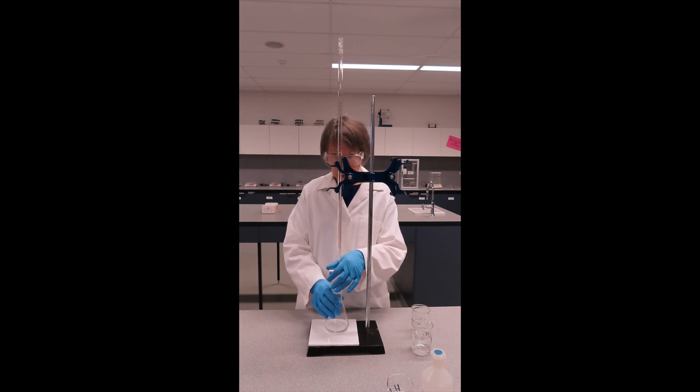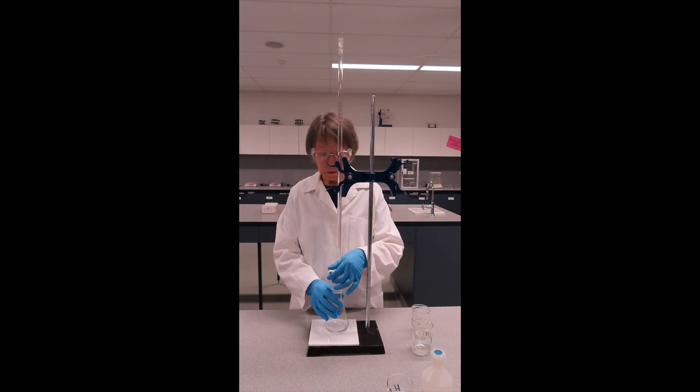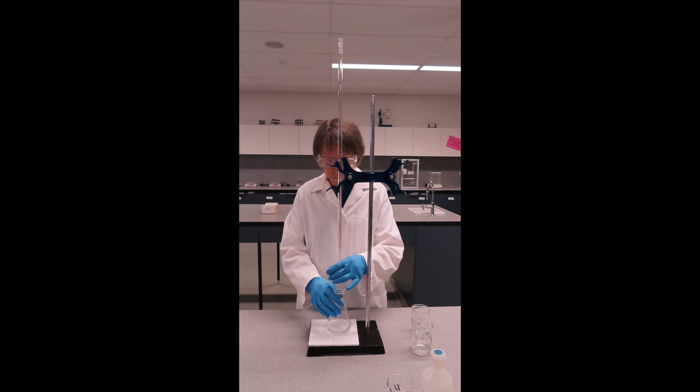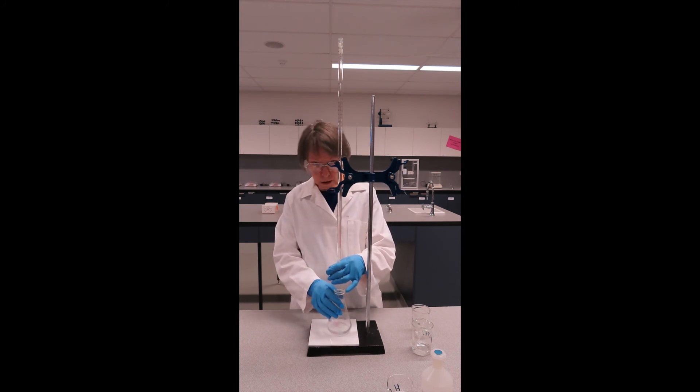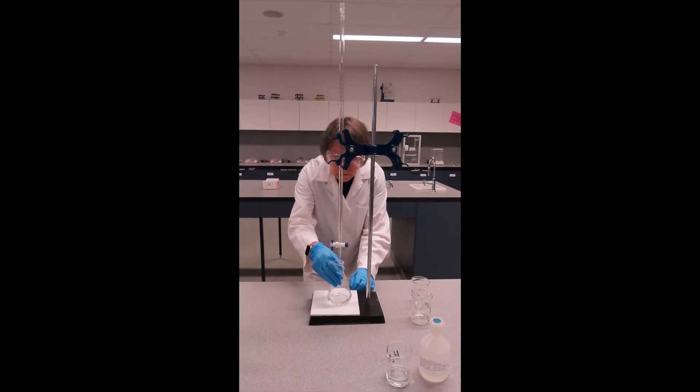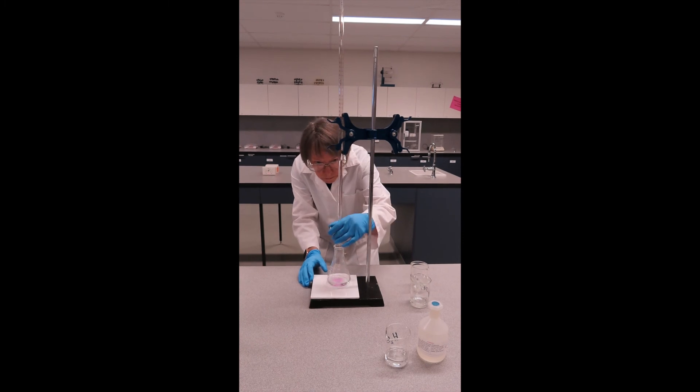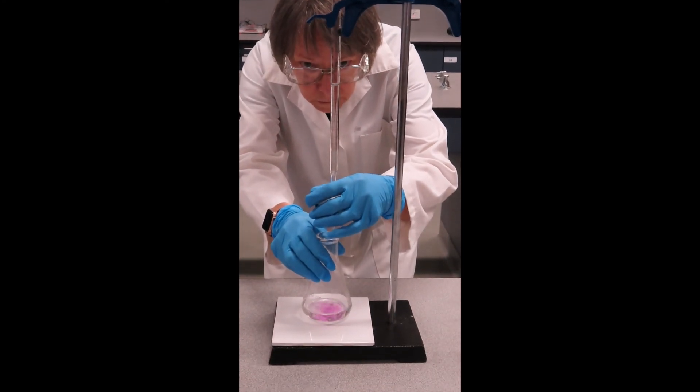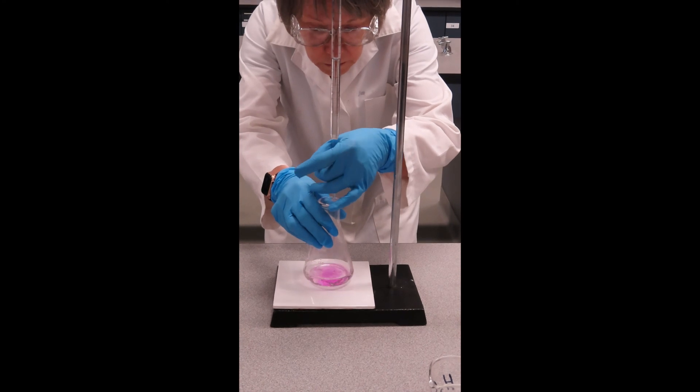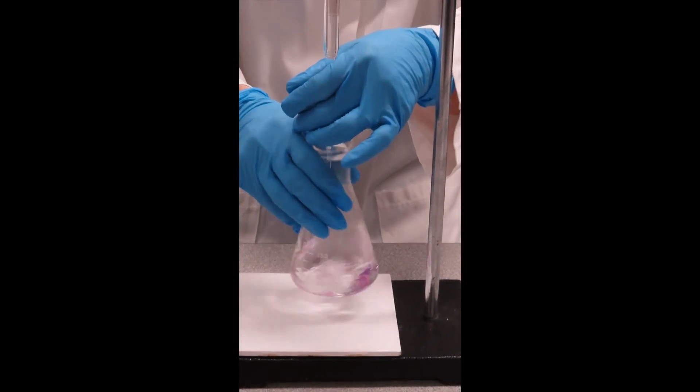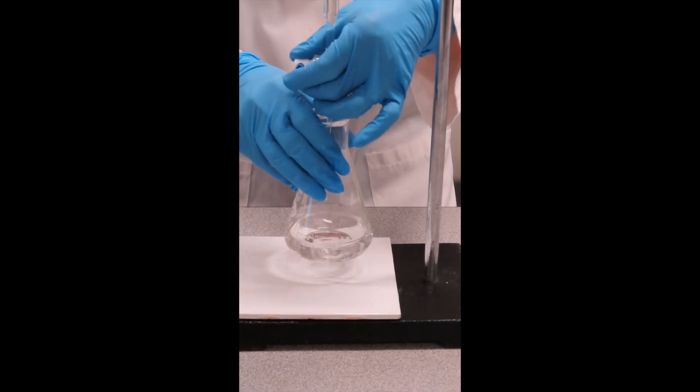I have recorded my burette level and I know that I have enough solution left in the burette to do a second one before I need to refill. Now I know that I can run it in fairly quickly for about 20 mls. So that will take me down to 43. So this is near the end point.